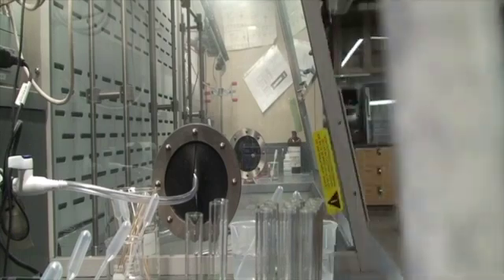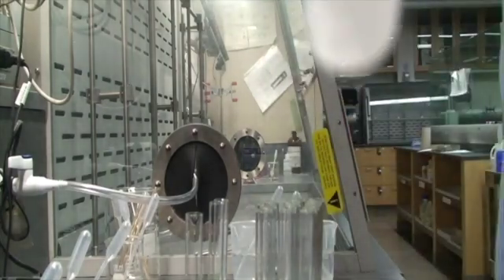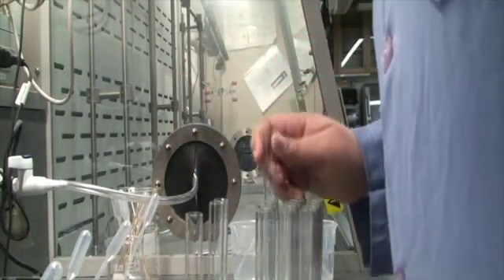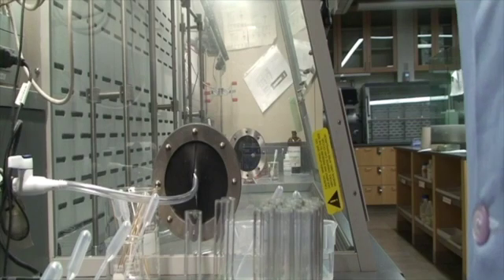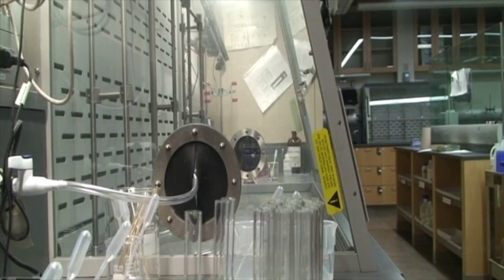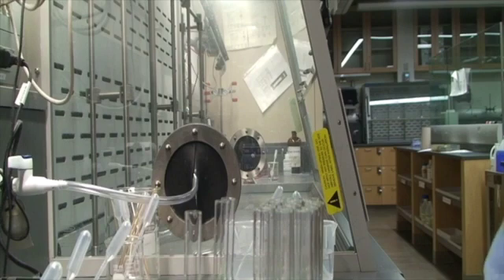This is why we try different things when we do chemistry. So there's definitely a precipitate there. But no smell. All right, so we went through all of our unknowns and reacted them with one another. So let's pause and think about one thing. For 8 and 13, when I said that it felt a little warm, it definitely did. I didn't feel anything else that made me doubt that. So 8 and 13 is definitely a generation of heat.